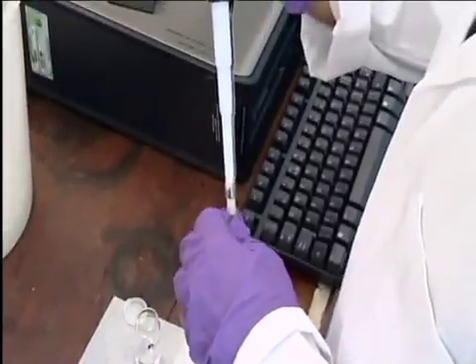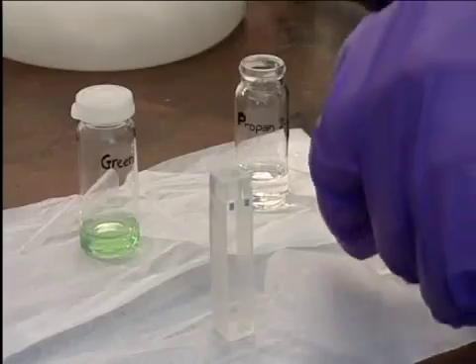To run the spectrum, we place some of the solvent in a sample cuvette to act as a blank, a reference.